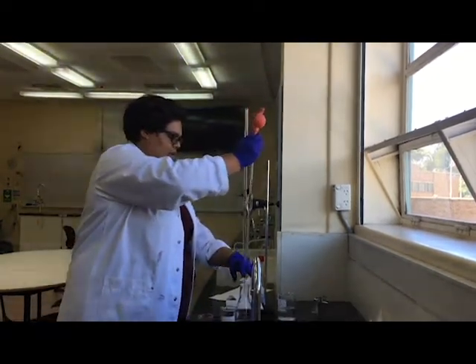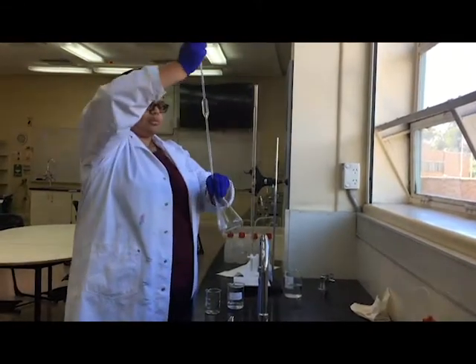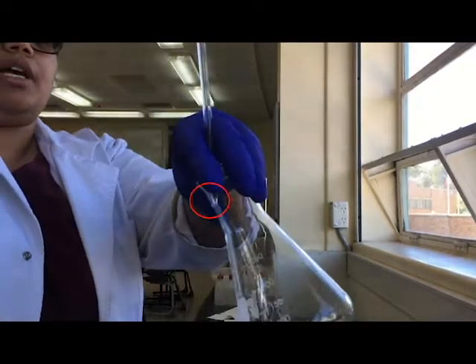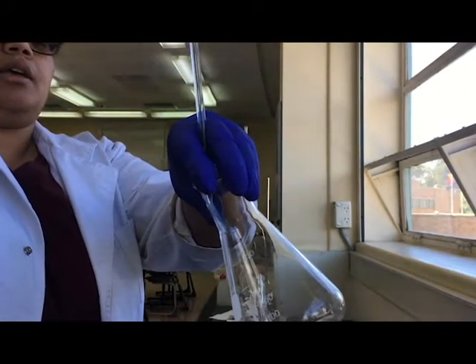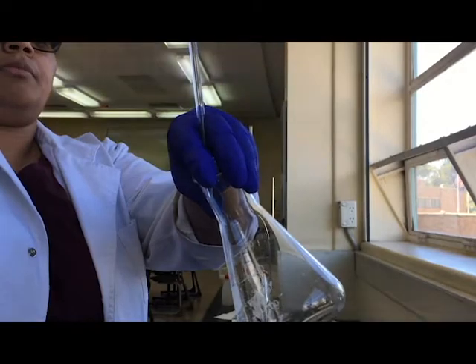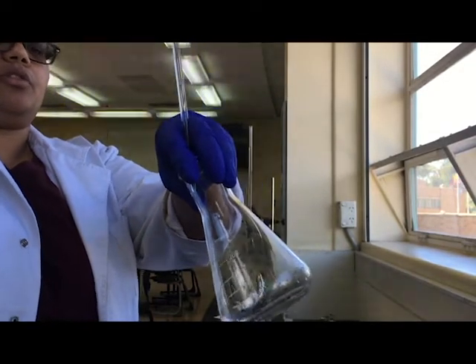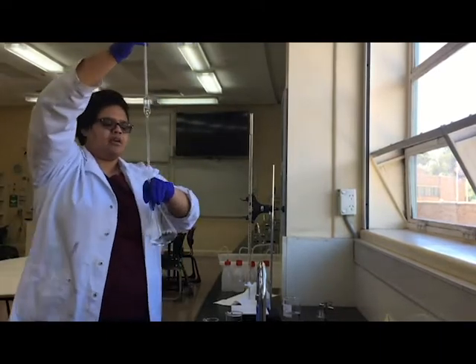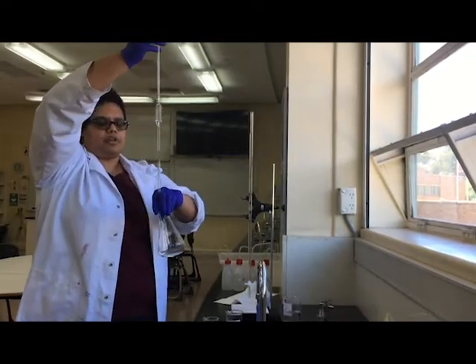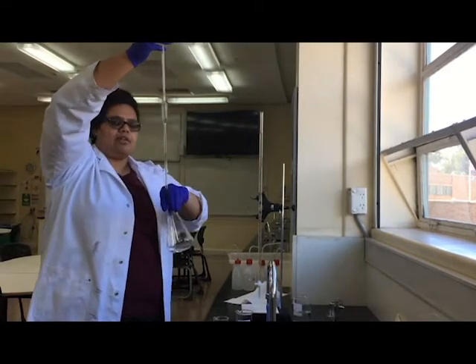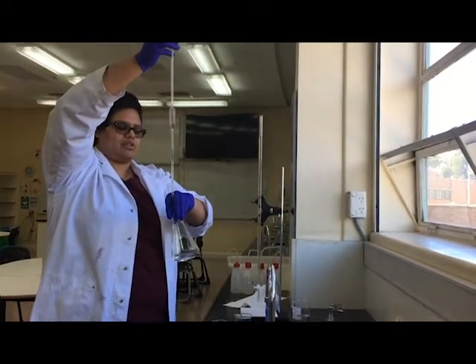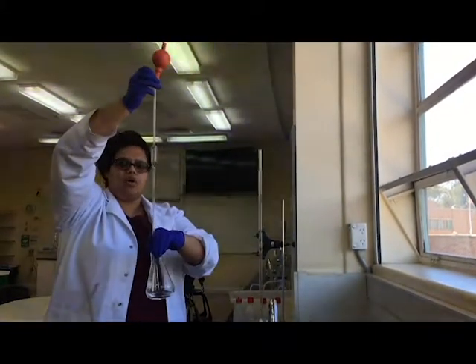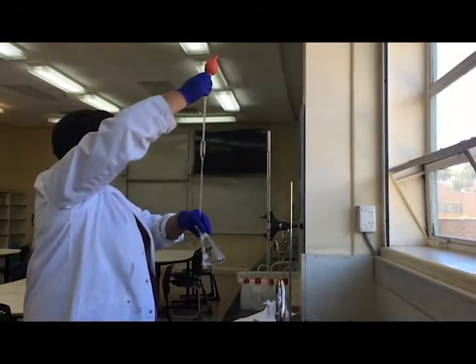So I'm going to put it into my conical flask. I need to make sure I transfer all of it, and what I'm going to do is touch the tip of the pipette to the conical flask so it's touching it but at a bit of an angle, and as I expel the liquid it's going down into the bottom of the conical flask. There was a little bit of water left over in the conical flask. That's okay, because the idea is I'm putting a certain number of moles of the hydrochloric acid into the conical flask, and if I've got some water in there, that's not going to change the number of moles, it's just going to change the concentration. But the whole point of the titration is seeing how many moles is going to react with the amount of moles of sodium hydroxide.